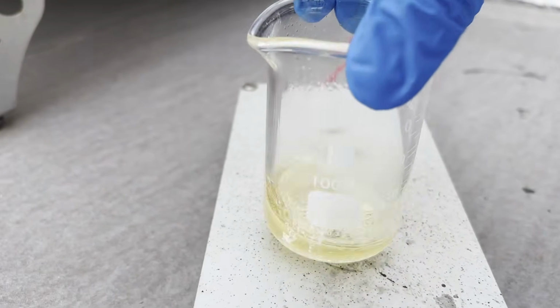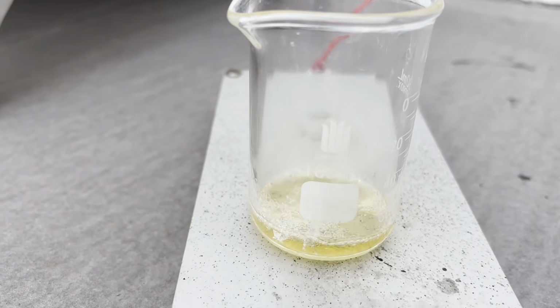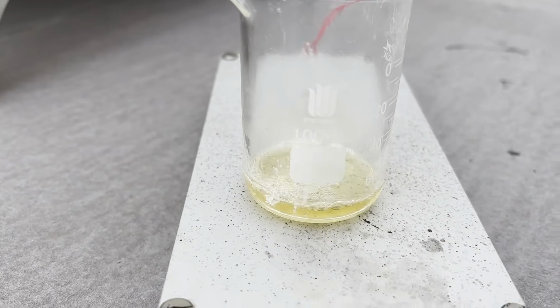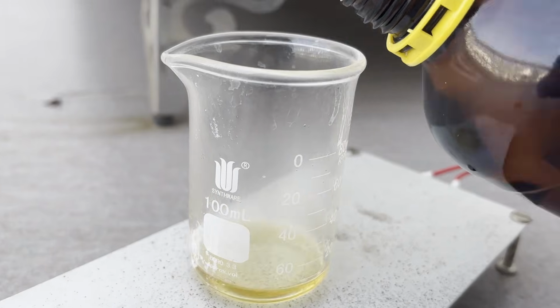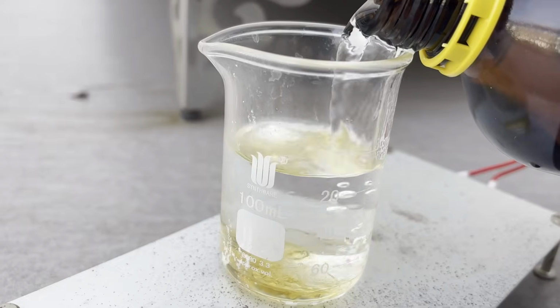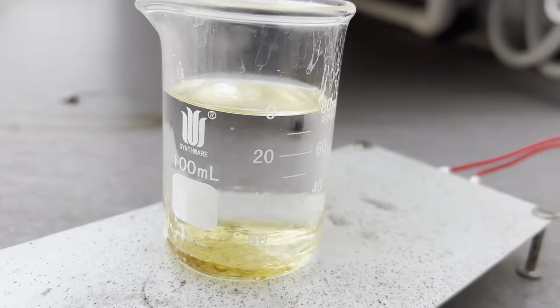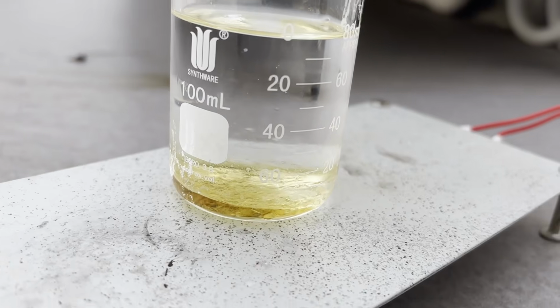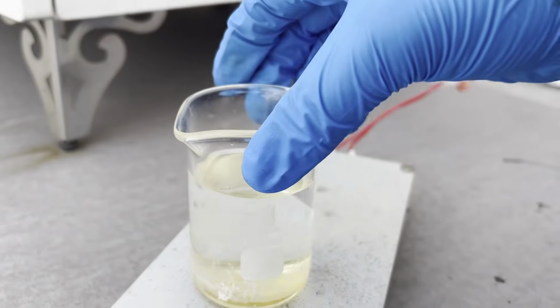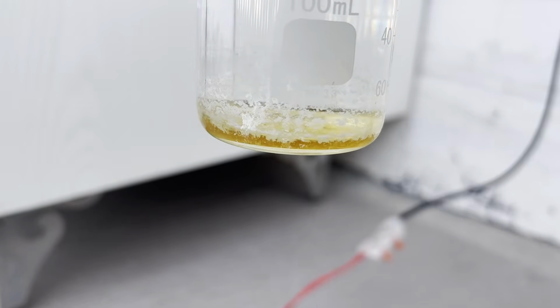The melting point of my product is 147 to 148 degrees C from literature, so there are definitely residual solvents and impurities in it. I directly added n-heptane to recrystallize this crude product. Here I made some deviations from the literature, as they used isooctane instead, and I poured in more heptane than required. I observed that the cold heptane solidified a portion of the yellow syrup into colorless crystals.